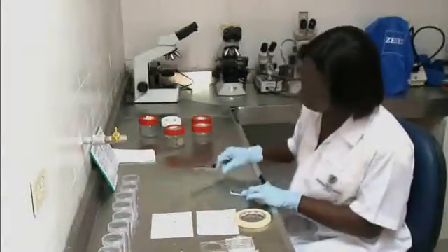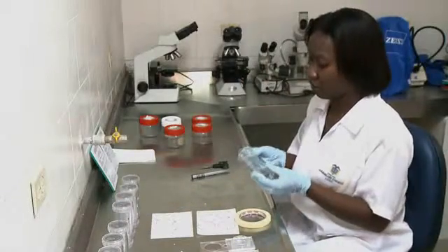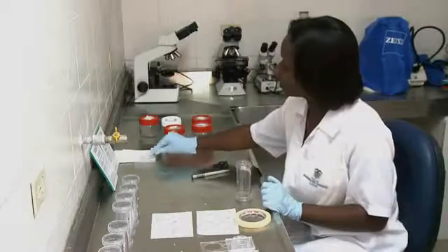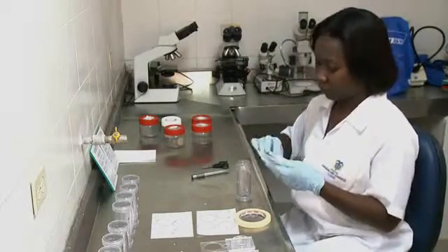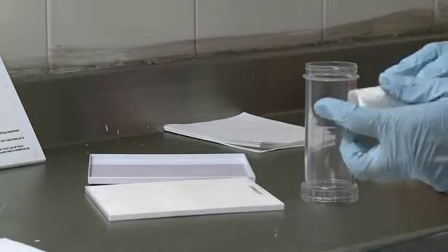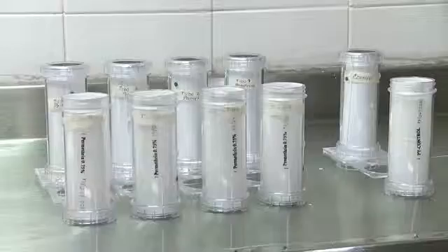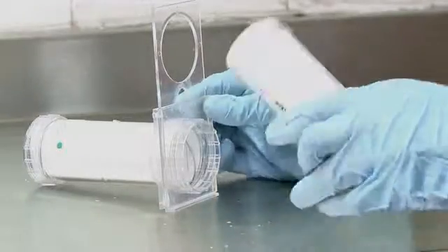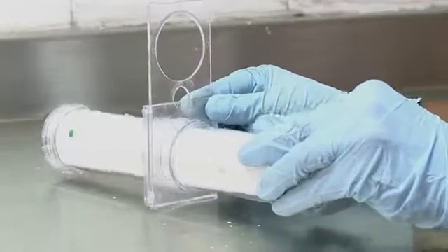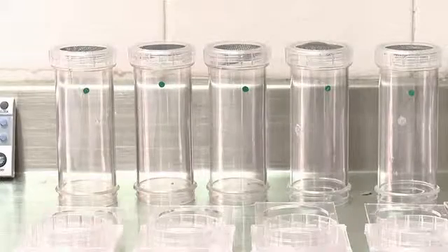Before starting the bioassay, label the resting tubes and the control tubes. Then put the papers in the tubes, starting with the insecticide-free papers in the resting tubes, then the control, and lastly the insecticide-impregnated papers. Remember to insert the paper with the name of the insecticide facing out. Every exposure tube corresponds to a resting tube. Remember to use the correct tubes for the impregnated papers, those with the red dot, and for the control, those with the green dot.